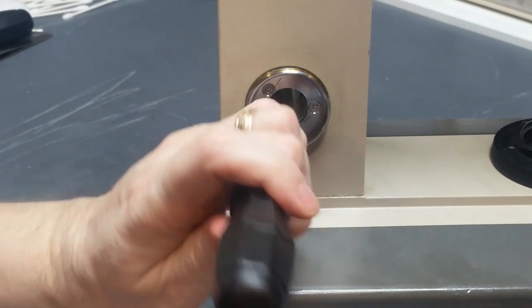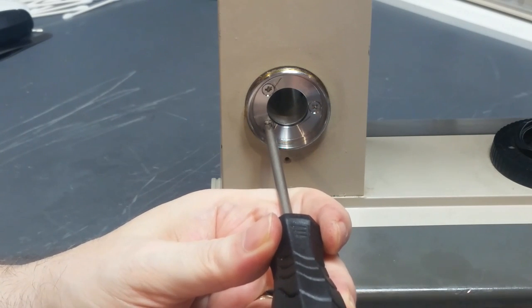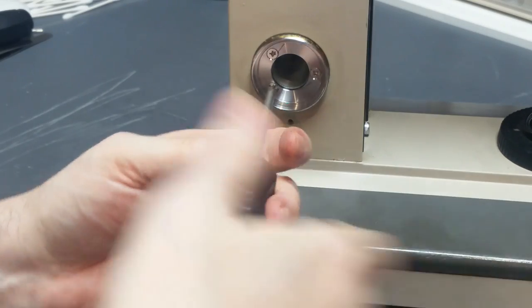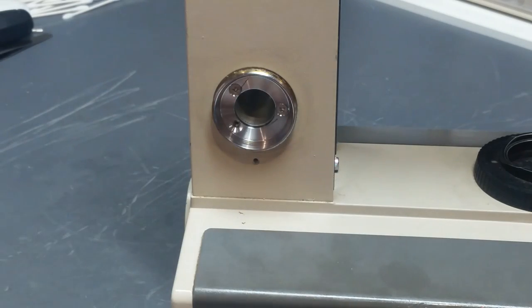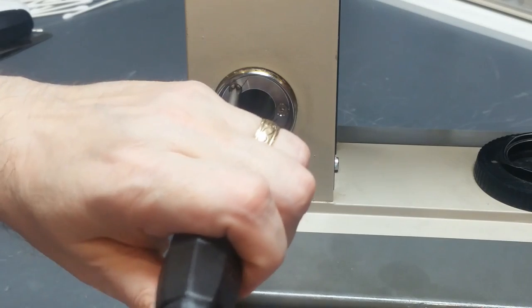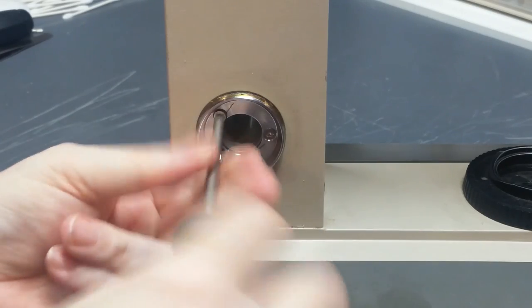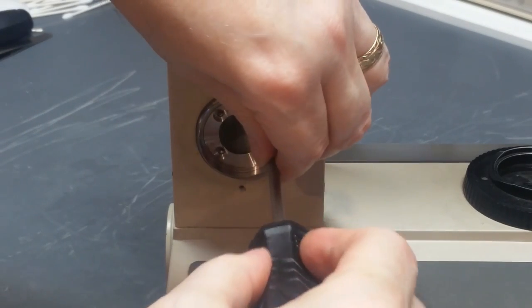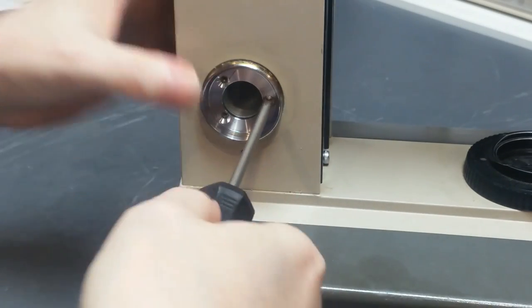But the way I do this, if I do want to remove it, I find a screwdriver that fits the head perfectly. I give it a couple whacks, and if there's any glue in there, that has a chance of at least fracturing that glue bond so that it'll come out without damaging the head. That one came out. So far, so good. Do the same thing on the other two screws. Another thing that whacking does, if there's any burrs or debris in the screw head, it flattens that out and lets your screwdriver fit just a little bit better. And sometimes you need all the little bit betters you can get to make this work. They're out.